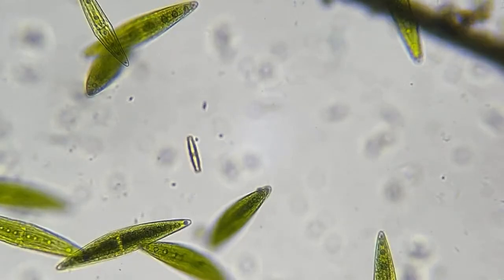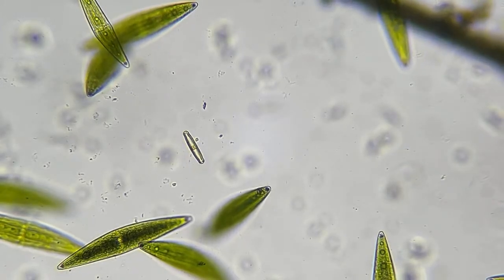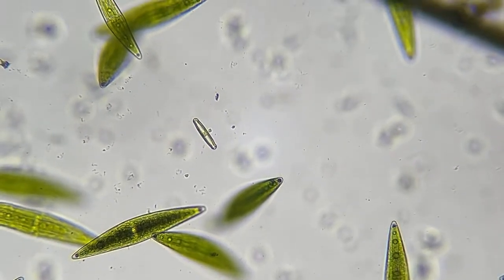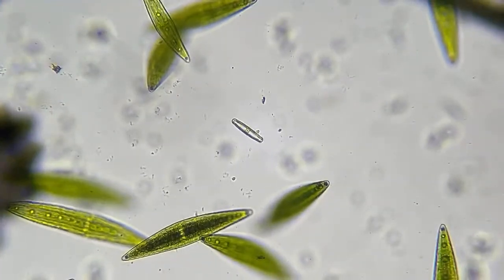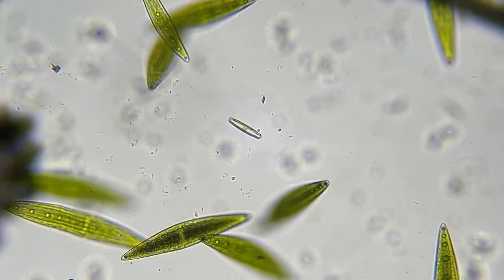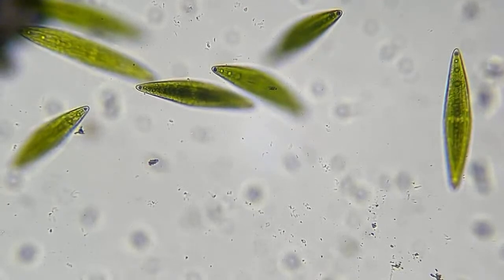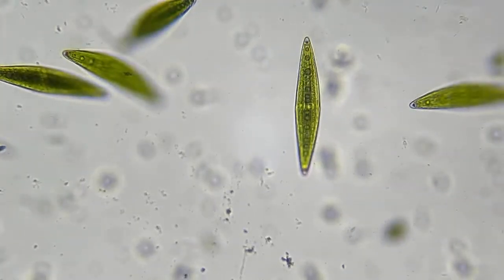That is a diatom right there. So that's not even an algae. That's less than an algae. That thing has a glass shell, and those things are all over the ocean, diatoms, and most of them do produce oxygen. But these green ones right here, Closterium, that is an algae.